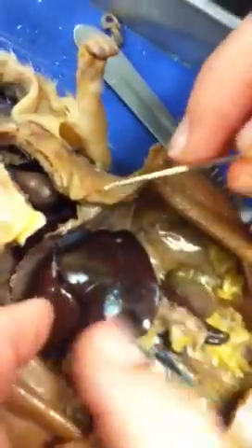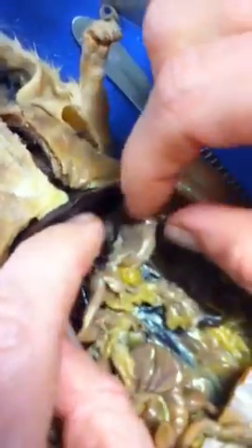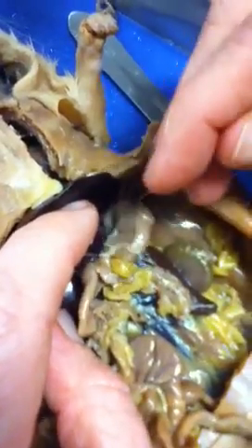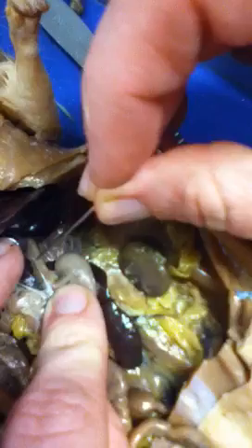Yeah, there's your diaphragm. And then this is your entire liver. So you have your medial liver. You have your left liver, right livers. Dorsal. Yeah, your dorsal liver's under there. Stomach. This would be your stomach. It is connected by your esophagus here.